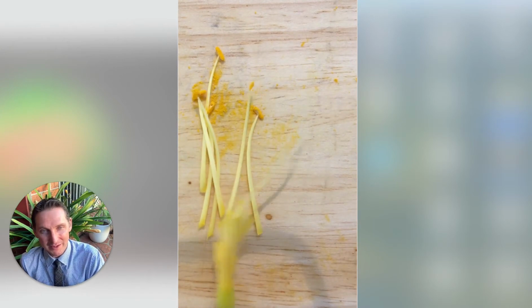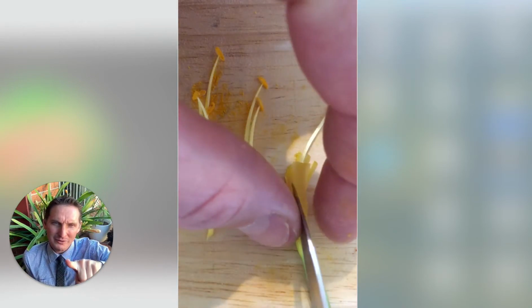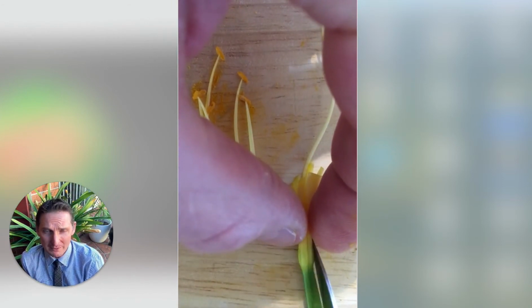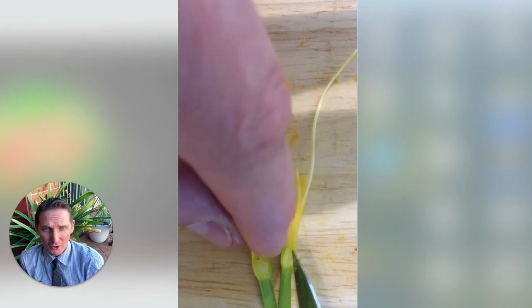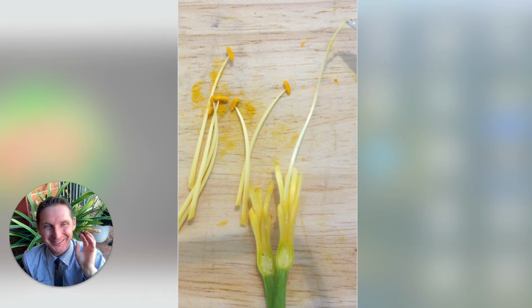Now I'm going to bring in the female part of the plant. So you've got the stigma at the top, the style, which is that long section here. Now what I want you to do with a fairly blunt knife, it's fine, just cut through the middle of your ovary, which is the one at the bottom, and you'll hopefully open it up and see all the eggs, all the ovules that are inside it. This is the most important one.